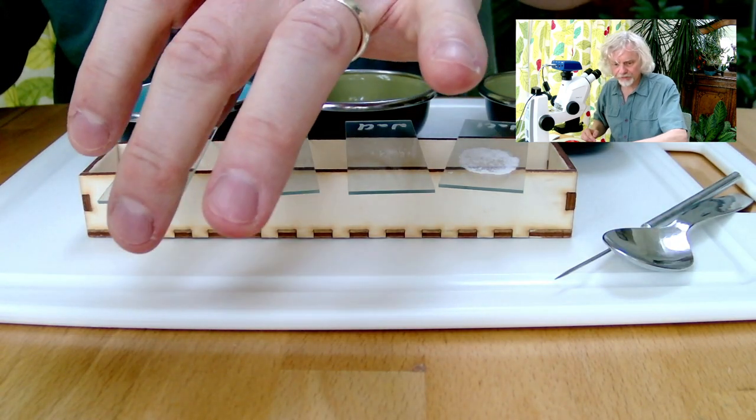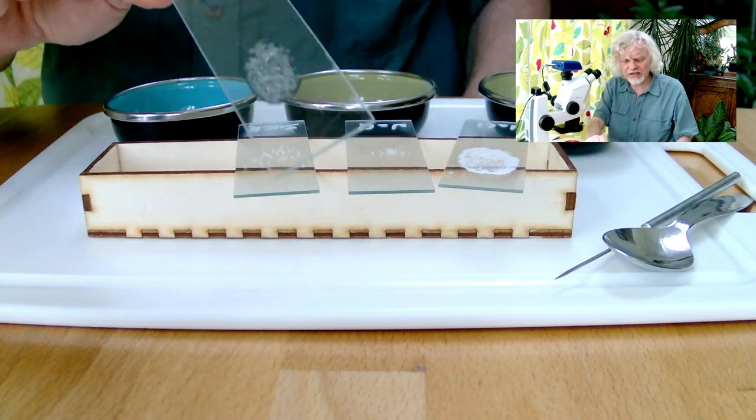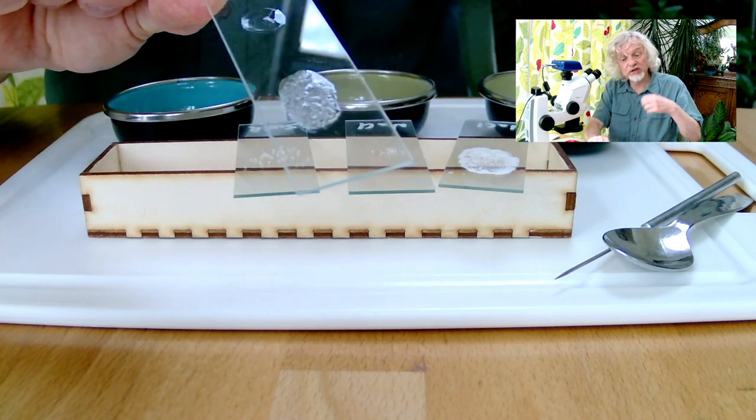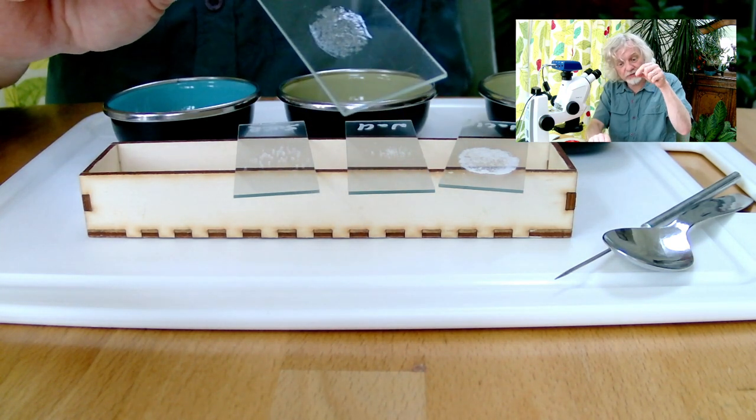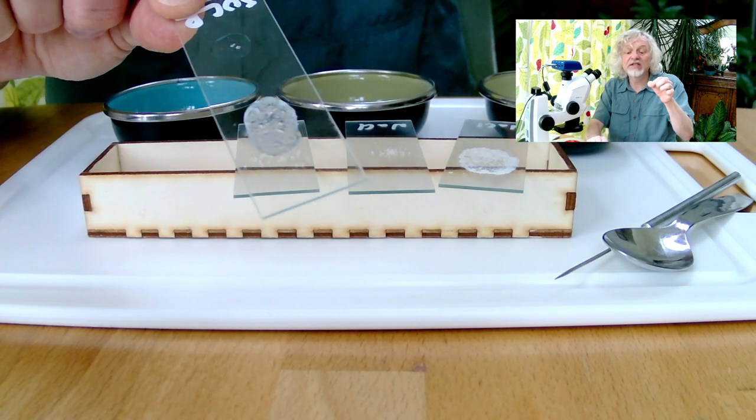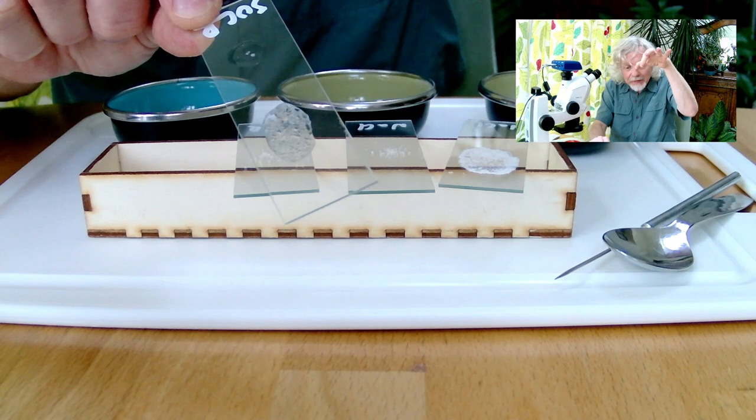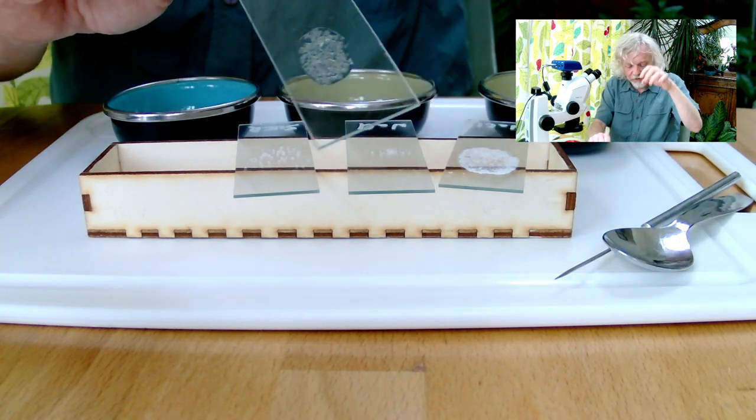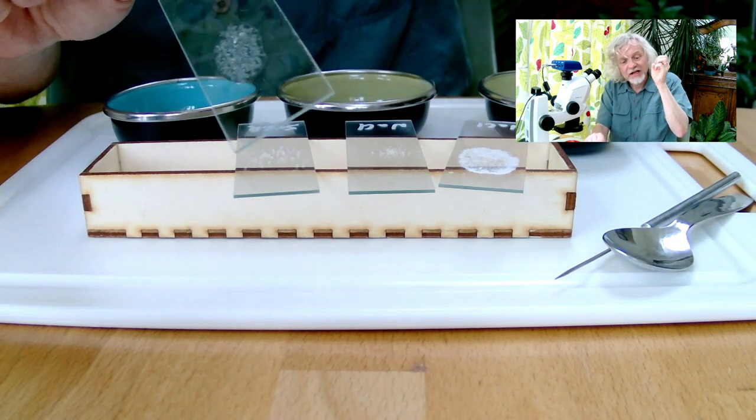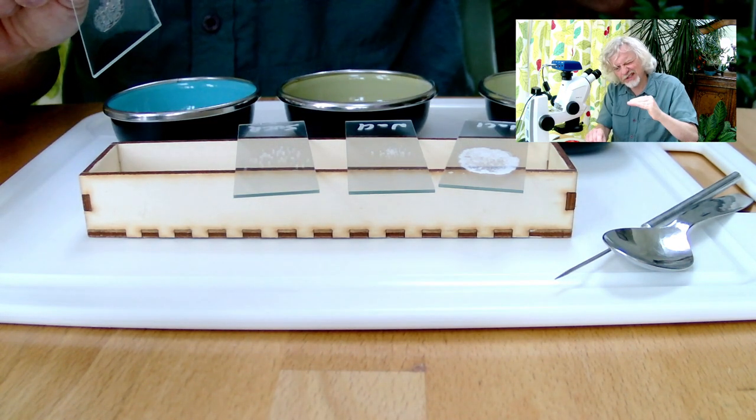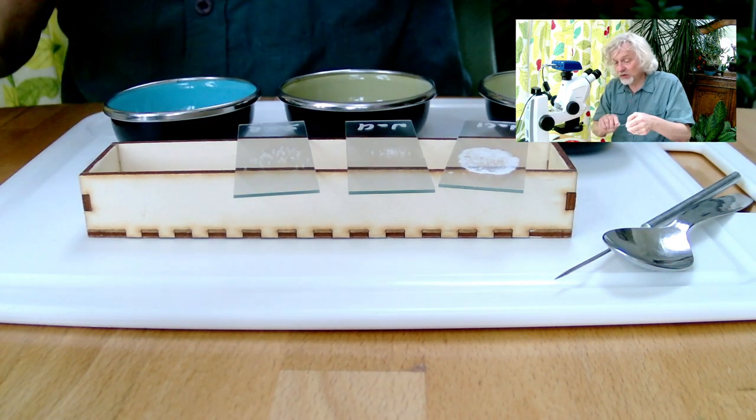Now, it's fairly straightforward. But what about sugar? So again, sugar's a bit more tricky. What I did was I took a little drop of water and dissolved a whole load of sugar in it. Sprinkled some sugar in and dissolved it. And then what you need to do to actually get it to crystallize, you sprinkle, you keep adding a few drops of, a few little crystals of sugar. So there's something to start the crystallization from. Because otherwise it just sort of dries out. Nothing much happens.